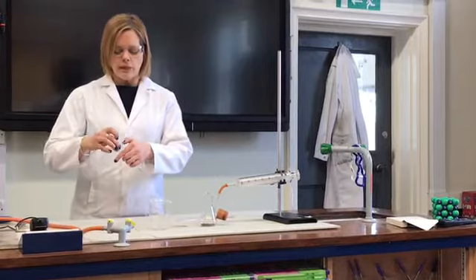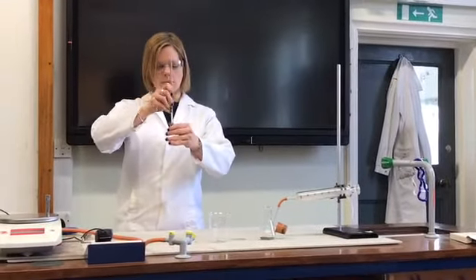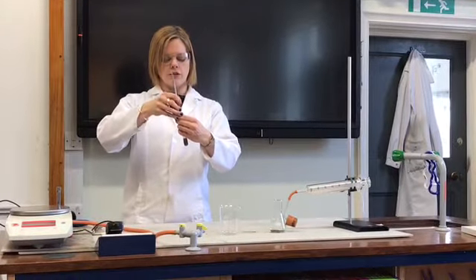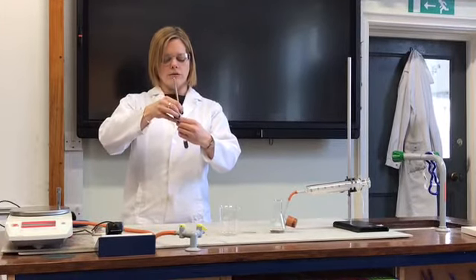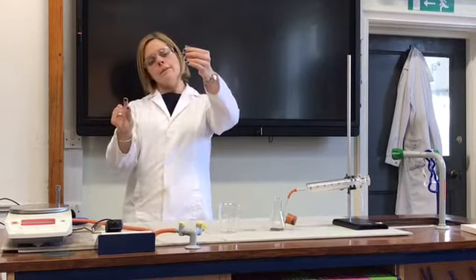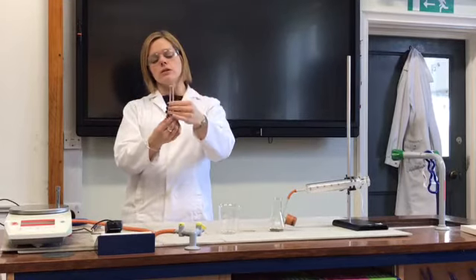So I'm going to take some iron wool and I've just popped some water into this test tube and I'm just going to carefully, using this glass stirring rod, push that iron wool into that water there. So we've got iron wool, iron, and water, and oxygen from the air, so this stuff is going to go rusty.